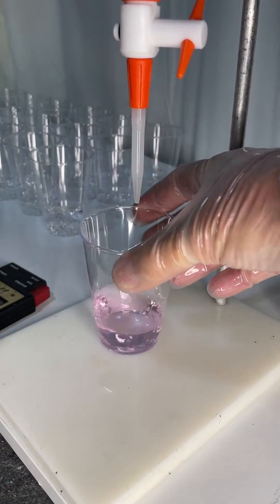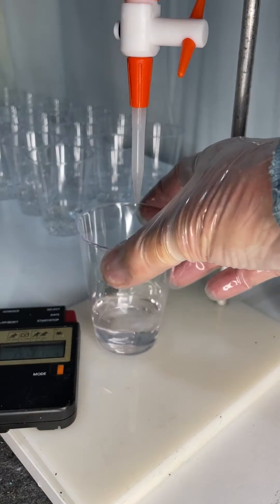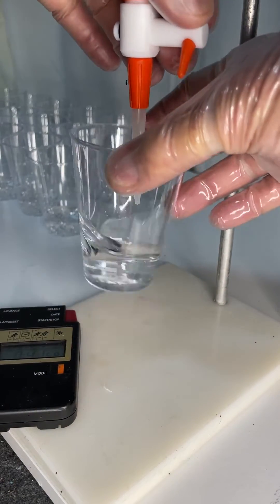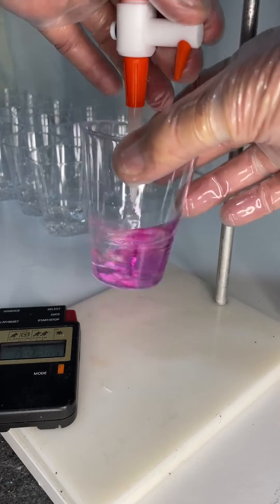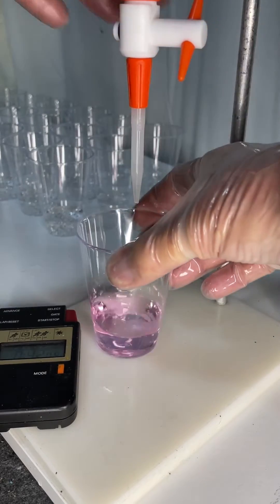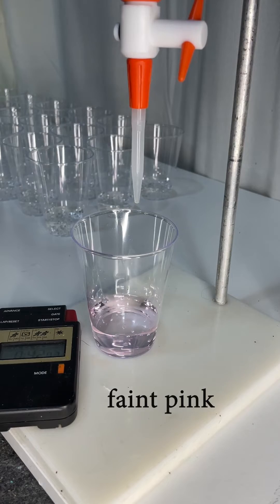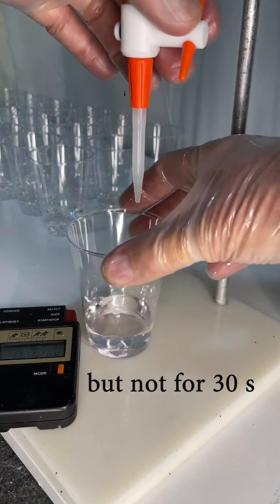You can see it's staying pink but not quite 30 seconds. It's gone now. So I add a few more drops of sodium hydroxide from the burette. It's gone pink again but you'll notice it only lasts a few seconds so we're not at the endpoint yet.